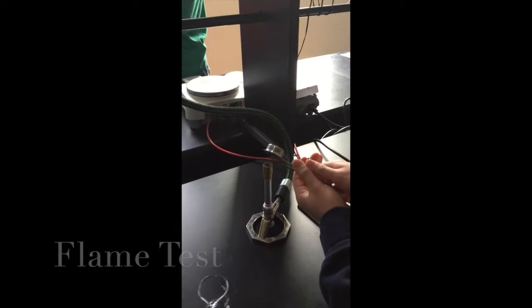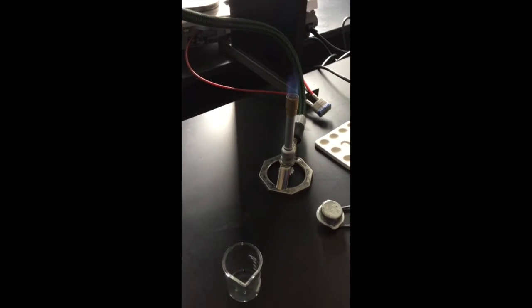After the color test or visual inspection test was complete, the group went and started the flame test. To go through a quick overview of the flame test, the group had to attach a flame tube to the gas valve and then turned it until it was perpendicular. This released the gas. Afterwards, we used a striker to start a flame. Then, we grabbed some Q-tips using the crucible tong, and then dipped those Q-tips into the different substances, both 20 and 21, and then held those substances up to the flame.